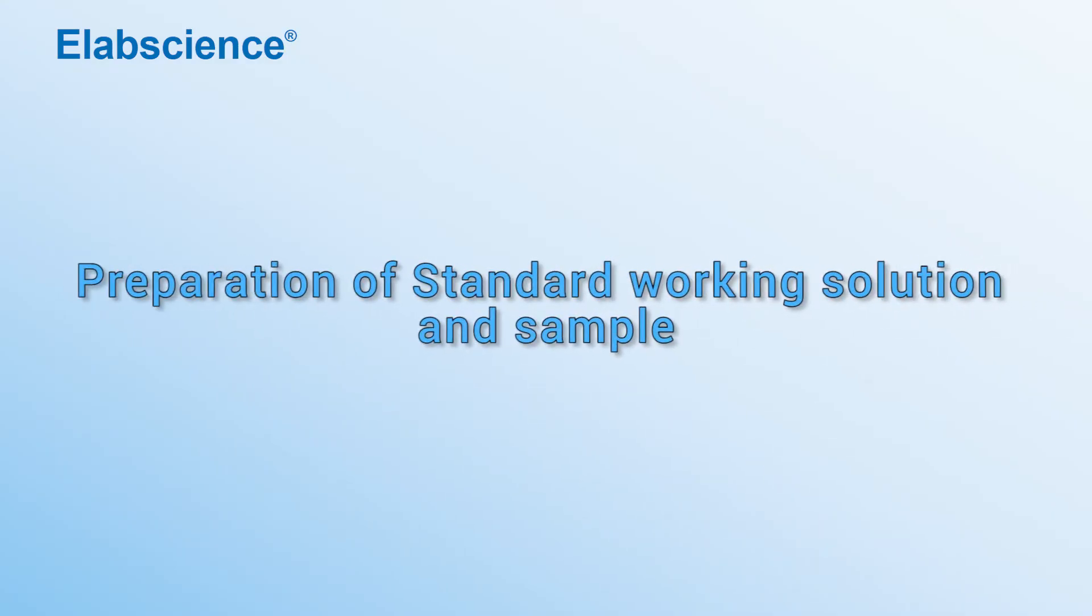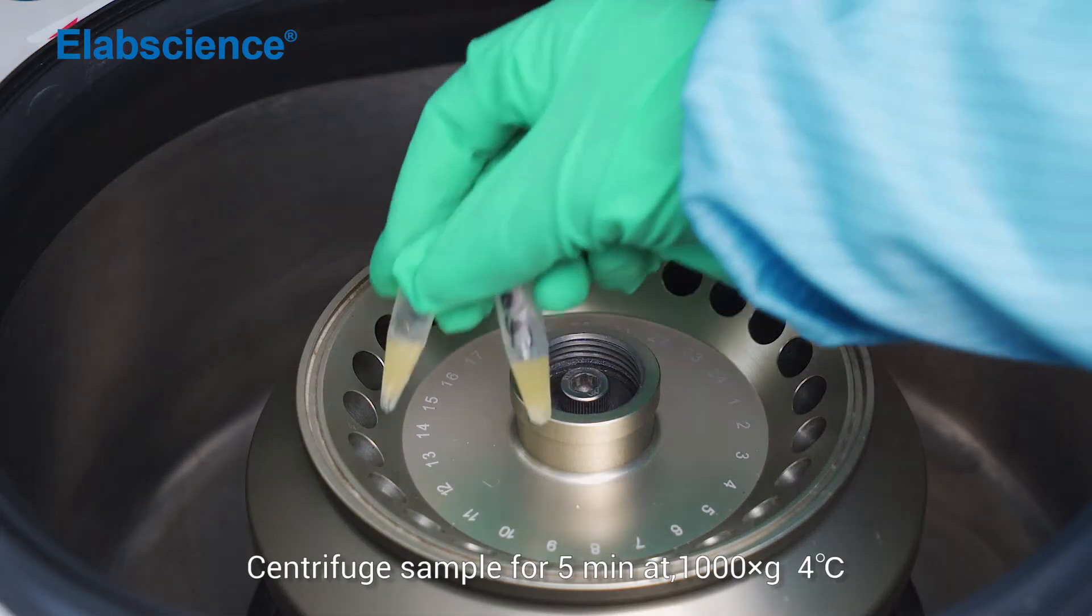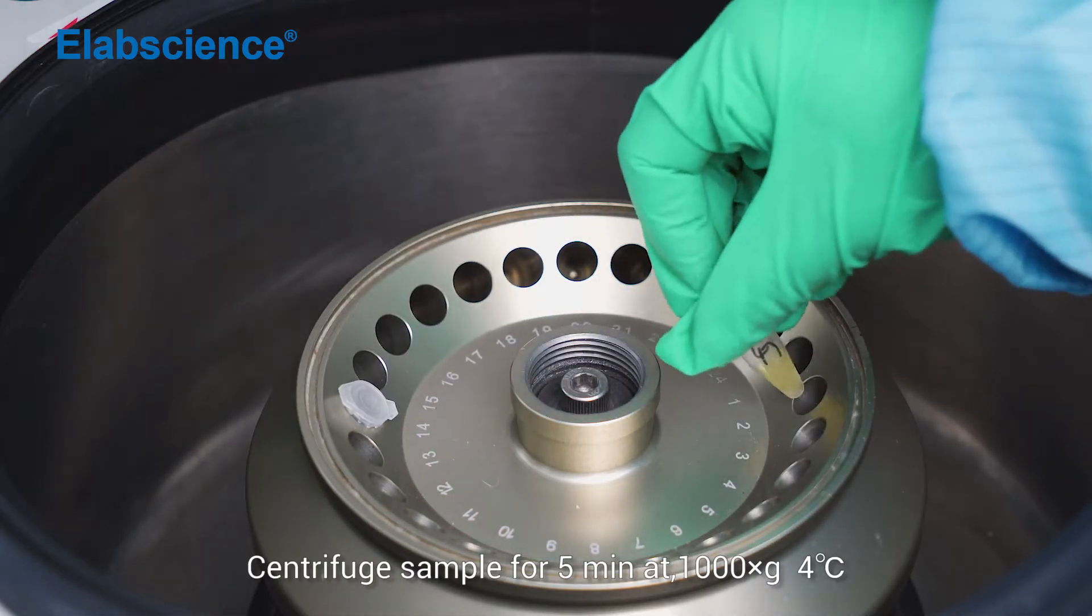Preparation of standard working solution and sample. Centrifuge sample for 5 minutes at 1,000 times gravity at 4 degrees.